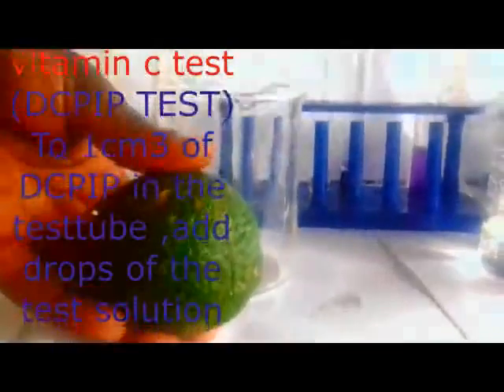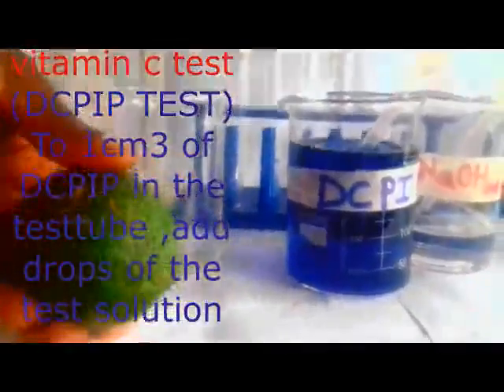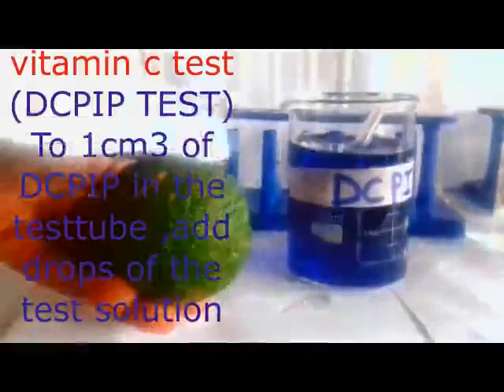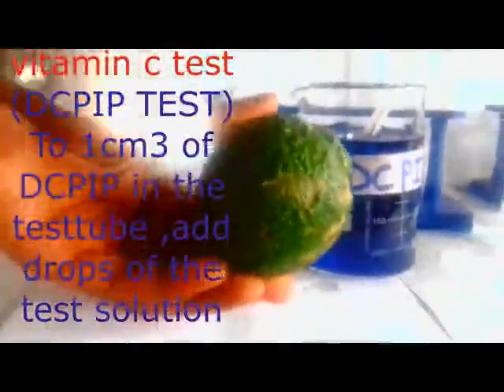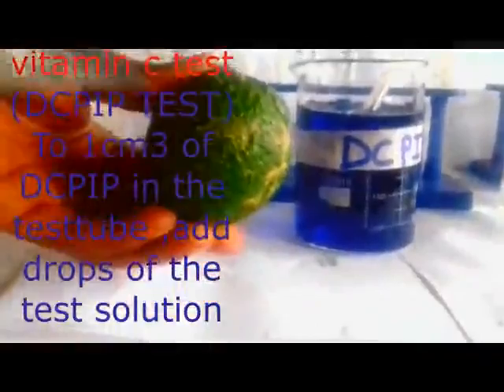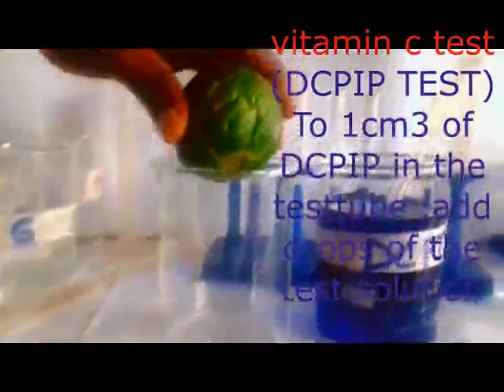Now, the other test, I think we are done with that one. We are going to look at what we call a vitamin C test. Don't forget that the chemical which is going to work for us there is DCPIP, or dichlorophenolindophenol. But now, we are going to obtain our vitamin C from one of the fruits which you always enjoy when you go to some parties. So now we have our lemon fruit here, but remember even in pineapple and many other fruits, we may get vitamin C. So I'm just going to cut my lemon, then I get my juice here.